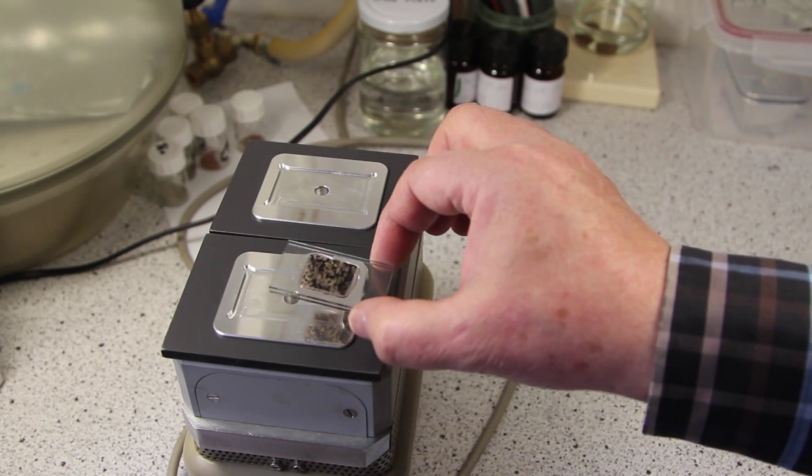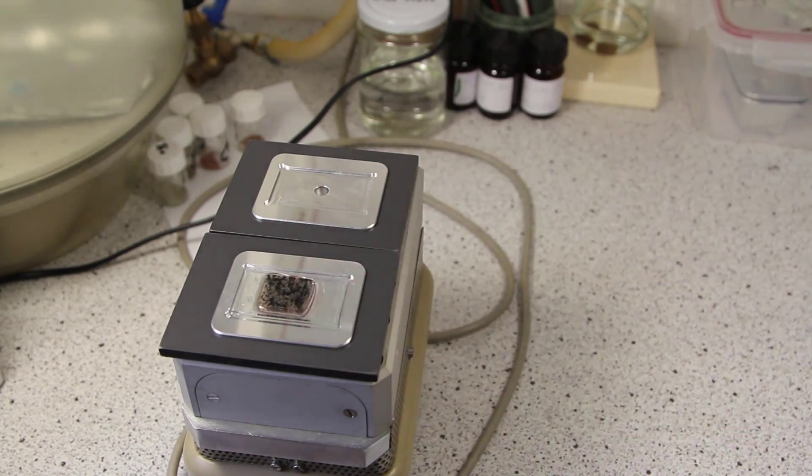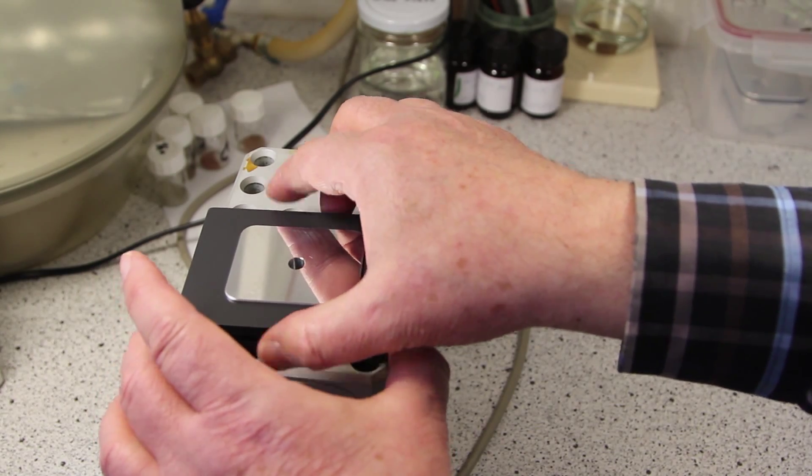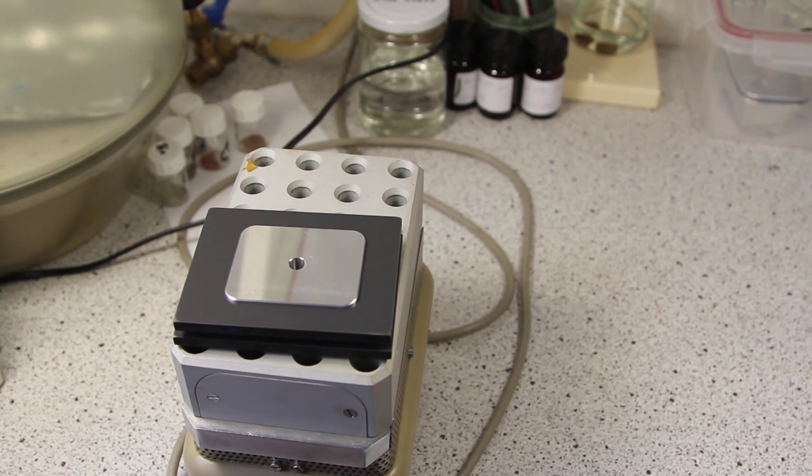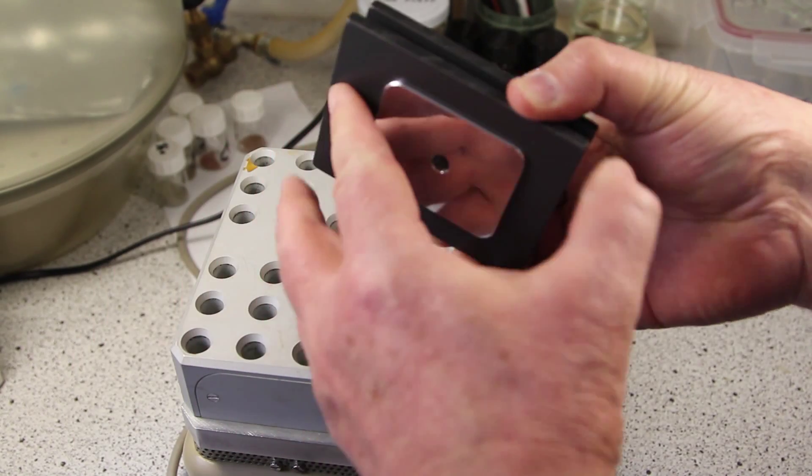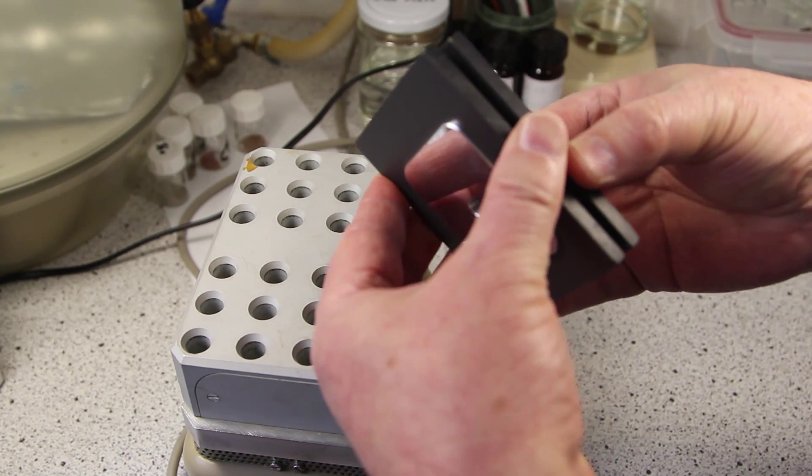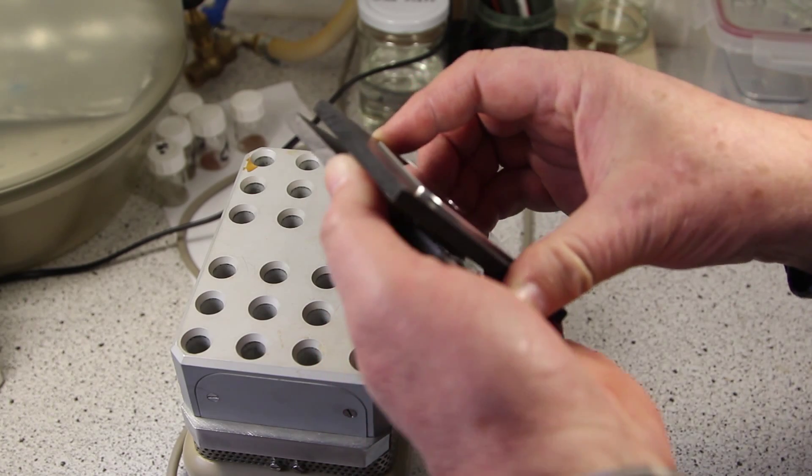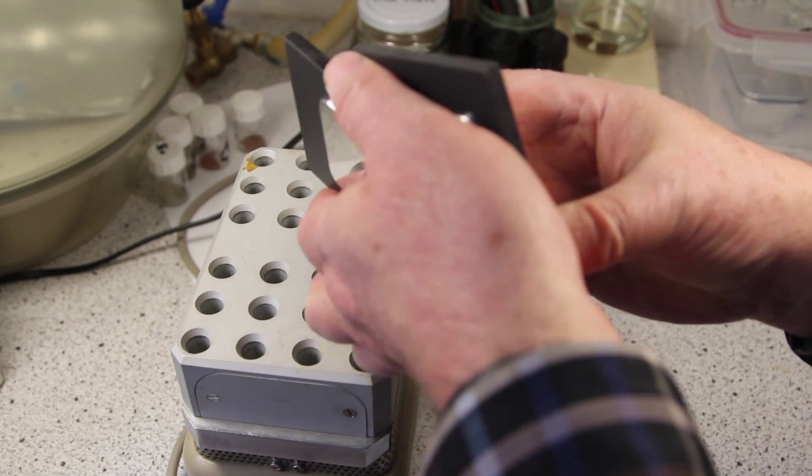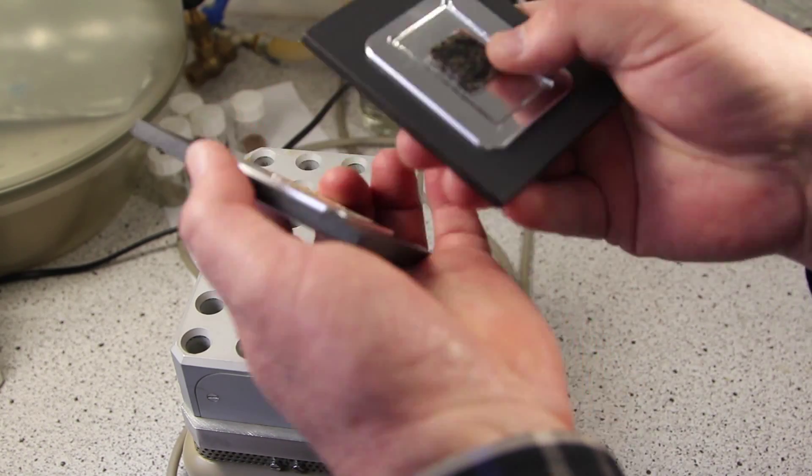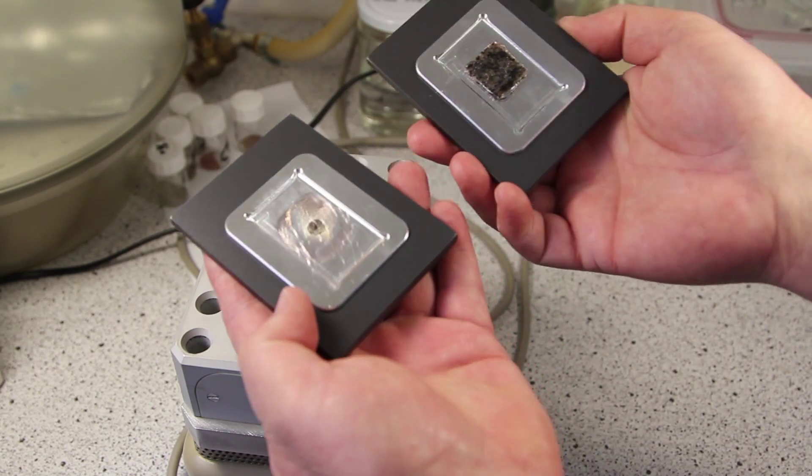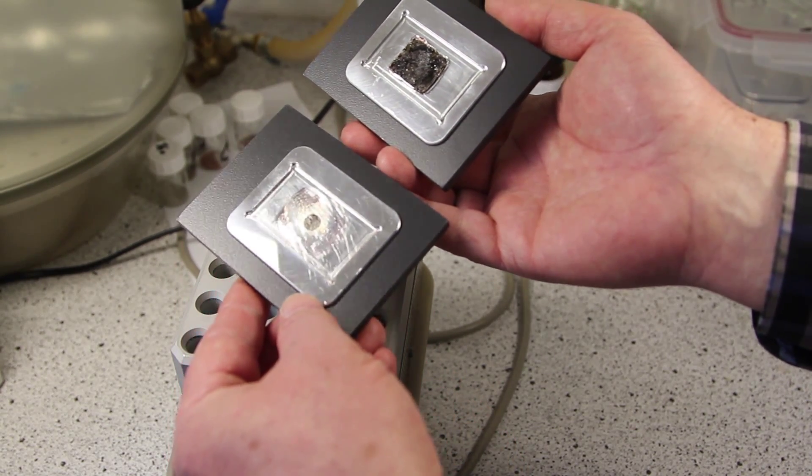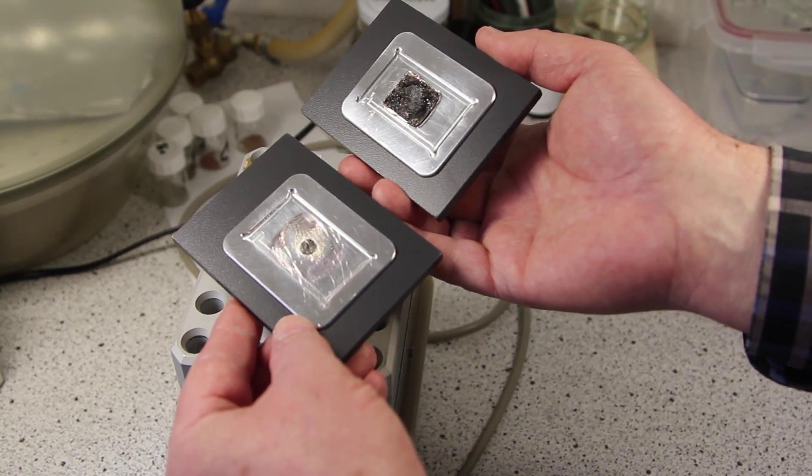Now I put the doubled sample into the separating tool. I close it, I leave it for some seconds. I take it, I watch out not to burn my hands. And now I can pry it a little bit and separate the sample. Now on one side here is the sample and here is the glass. We will work on the glass.